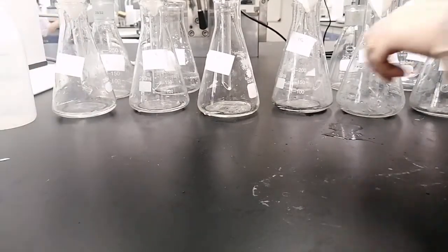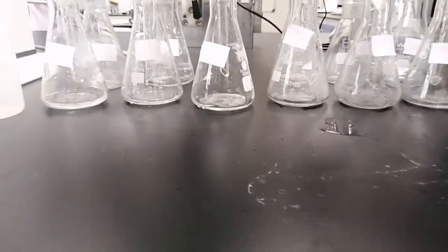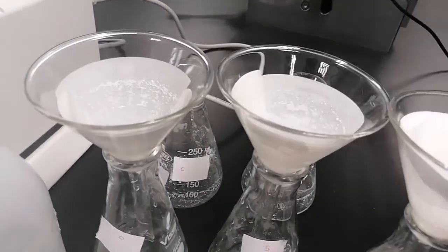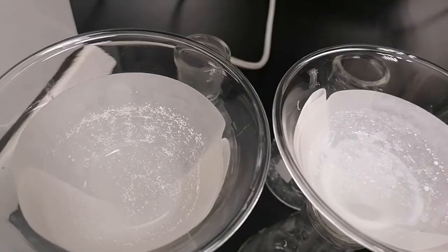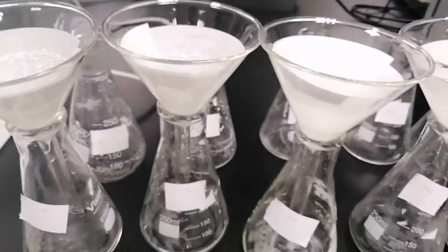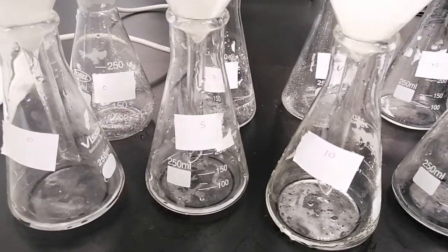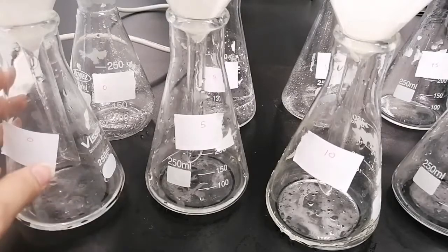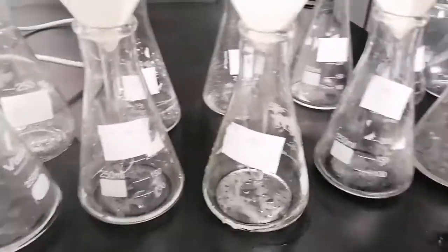But firstly, we need to withdraw 1 ml and fill it up to 100 ml of sodium hydroxide, the same concentration, 0.1 molar. Here's the filter cake. You can see some residues of the mefenamic acid on the filter papers. You don't need to wait for the whole amount to be filtered. You just need to take the amount specified for you, like 1 ml or 5 ml. You wait for the amount needed. We need 1 ml here, so we don't need to filter it all or wait for the whole time.